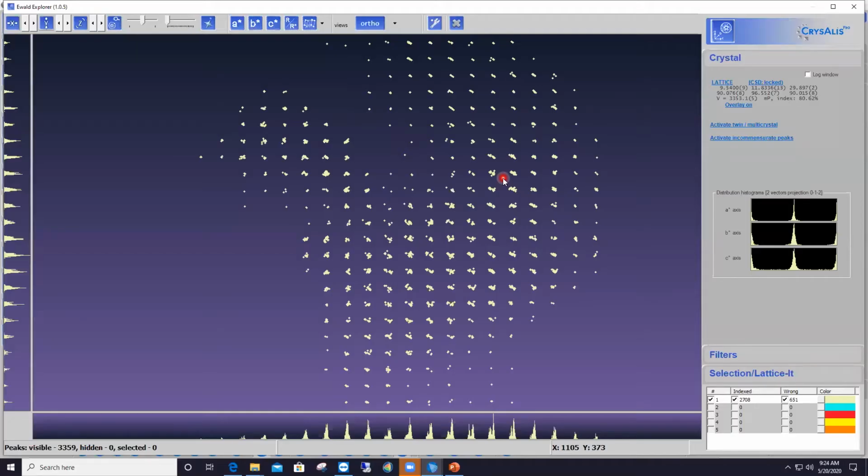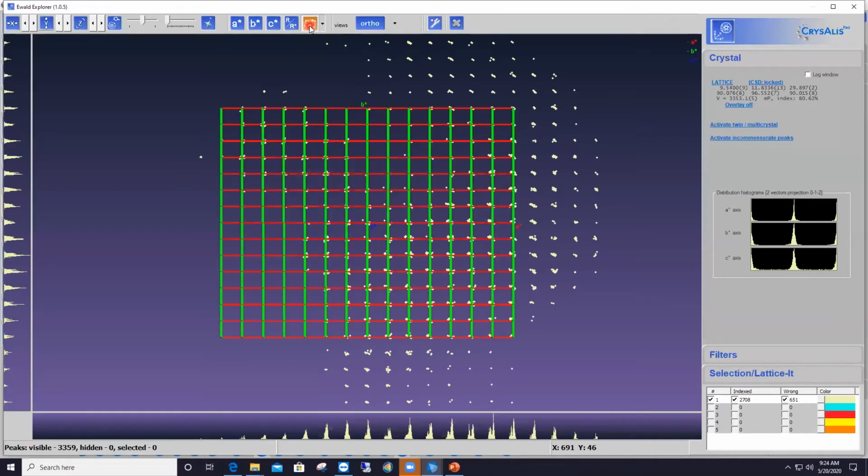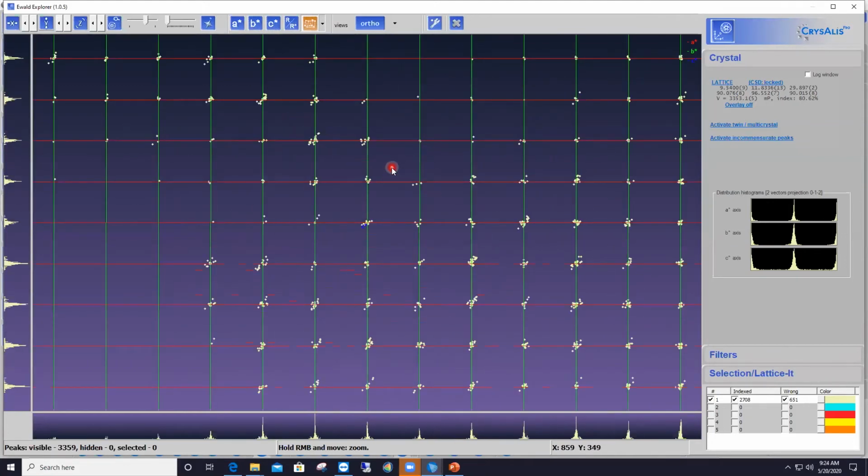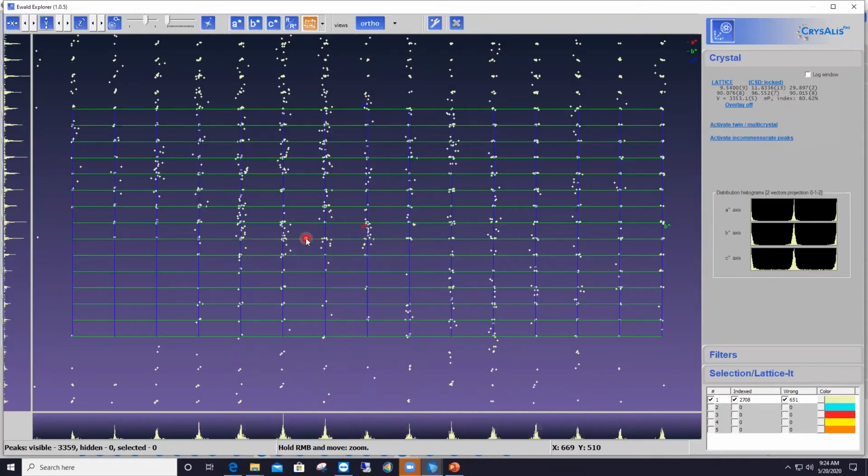within that new lattice. Okay, so I will go to the top of the interface here and click on that button that shows a lattice to bring the lattice itself back into the display. And I will show the whole diffraction along the reciprocal space axis here, along A star, B star, and C star, okay? So if I zoom in a little bit, you see that along C star, everything is beautiful. Along B star and A star, there might still be some cleaning that could be done, but you see that the majority of the reflections do coincide with the lattice points.